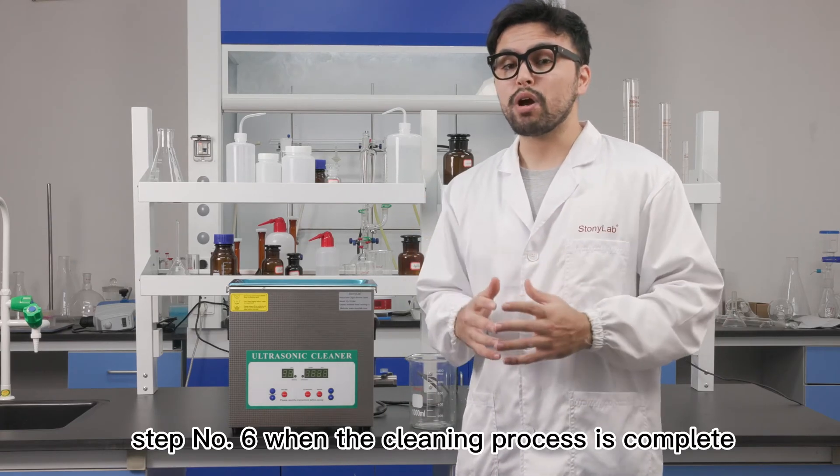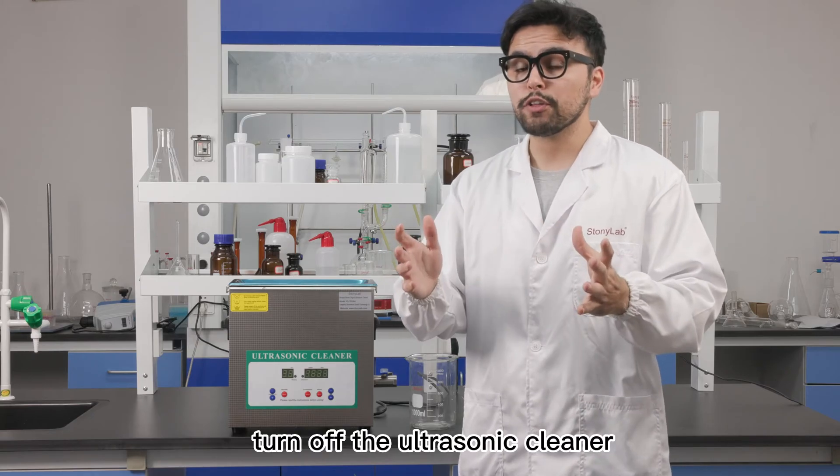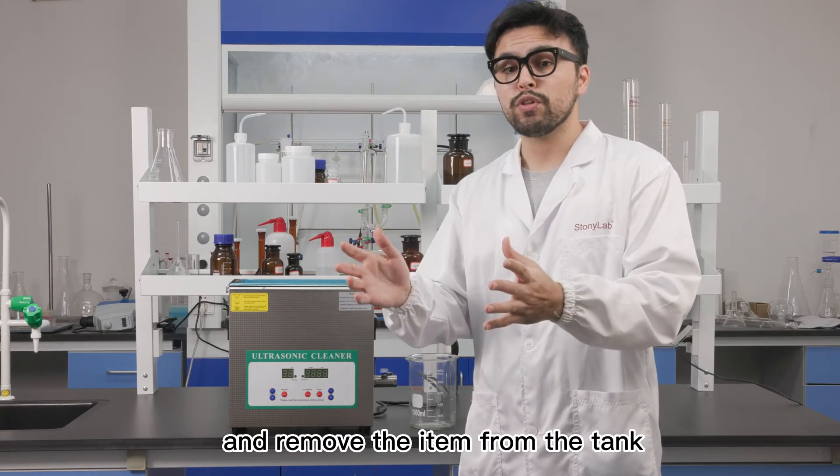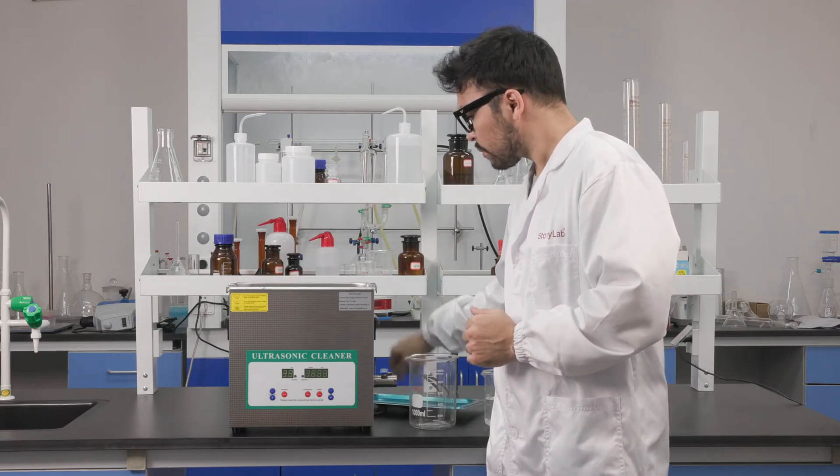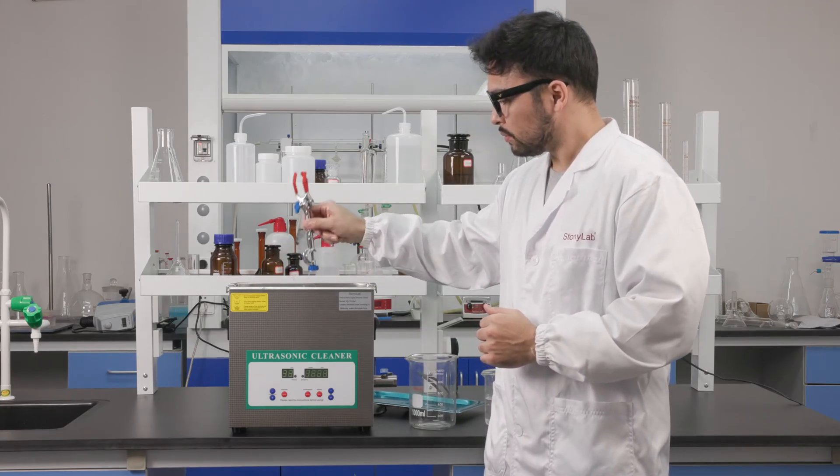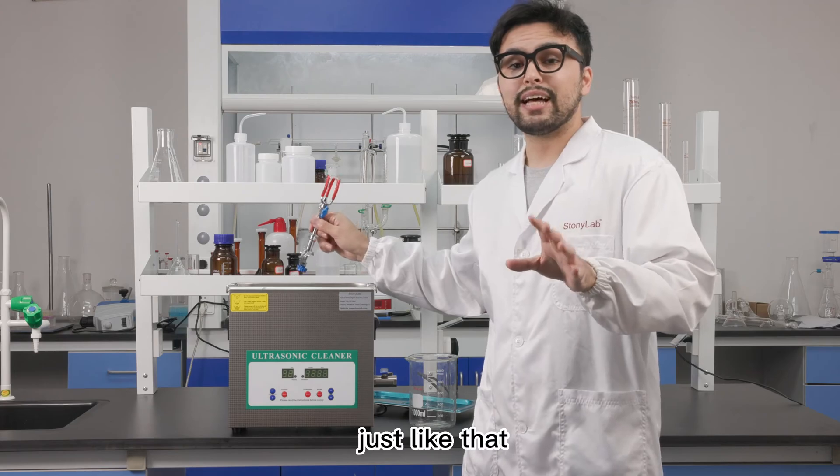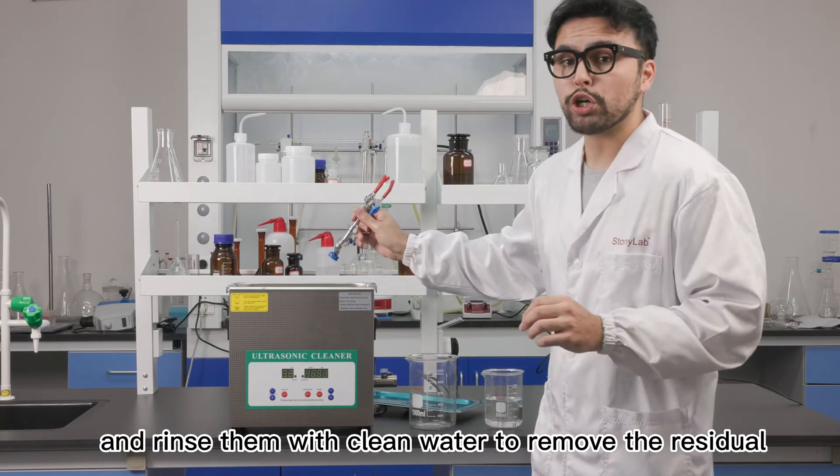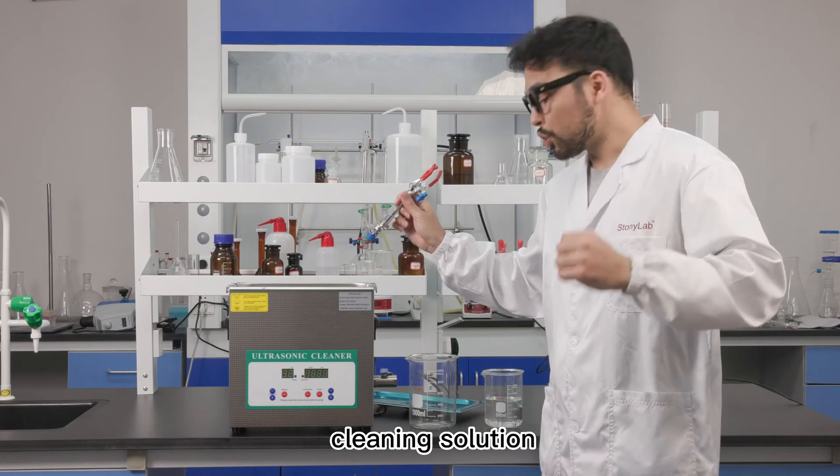Step number six, when the cleaning process is complete, turn off the ultrasonic cleaner and remove the item from the tank. Just like that. And rinse them with clean water to remove the residual cleaning solution.